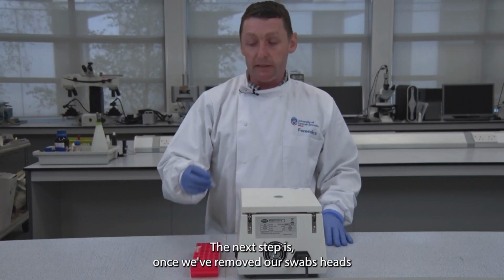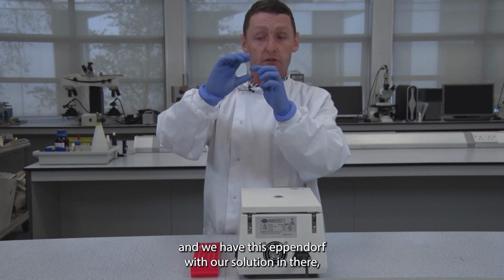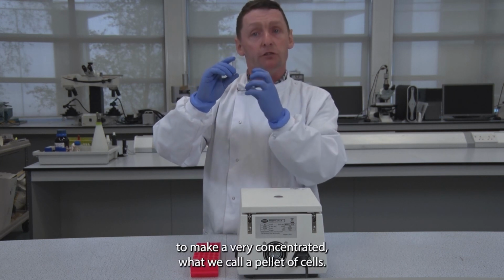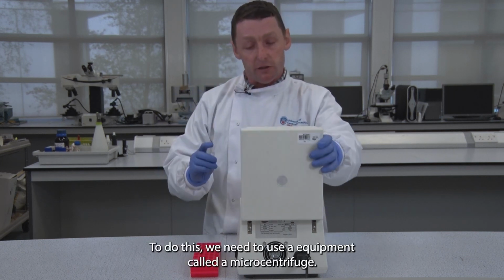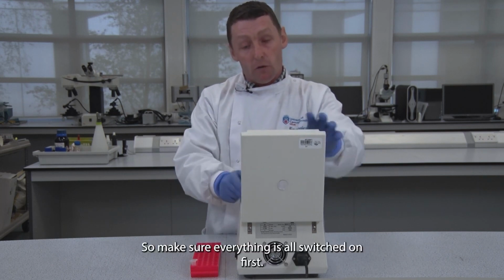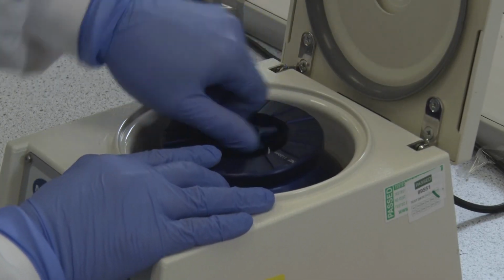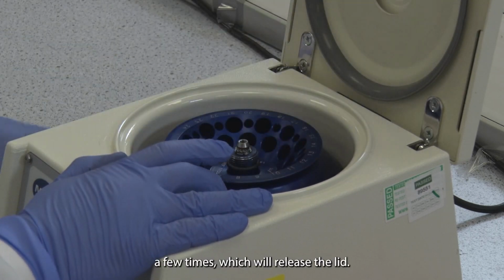The next step is, once we've removed our swab heads and we have this Eppendorf with our solution in there, we need to spin it down to make the sperm cells go to the bottom, to make a very concentrated, what we call a pellet of cells. To do this, we need to use equipment called a microcentrifuge. So make sure everything is switched on first, open the lid by pressing the button, undoing the rotor lid a few times, which will release the lid.